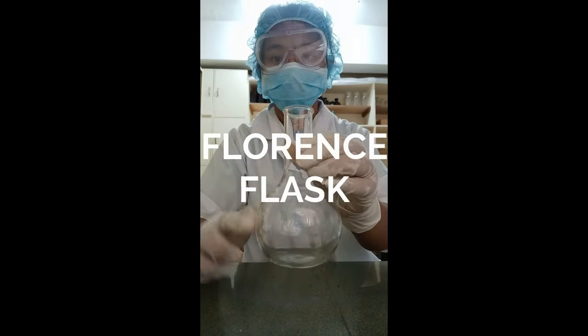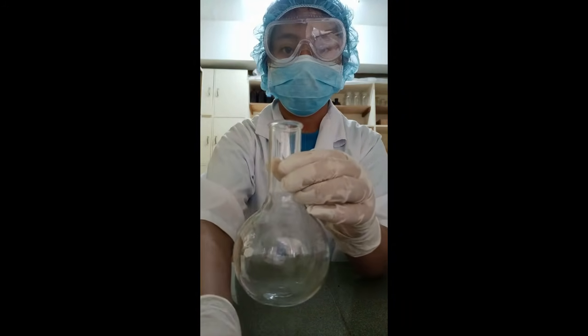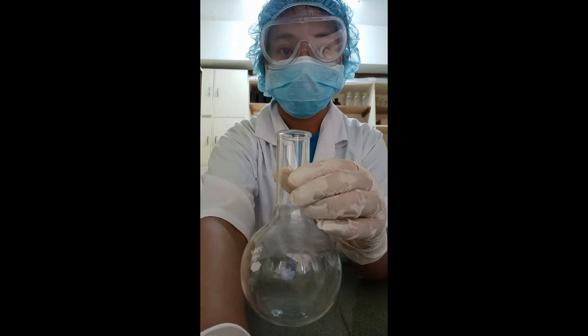Florence flask. It is also called the boiling flask. It has a round bottom and a long neck. It holds liquids and can be easily swirled and heated.